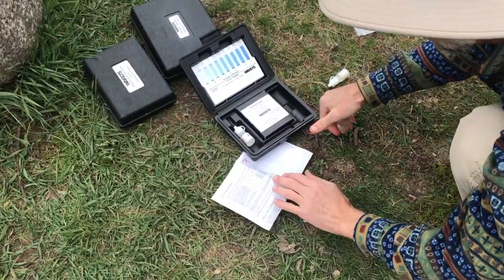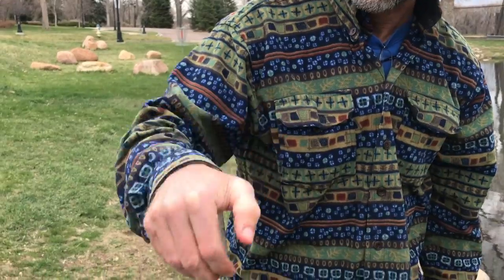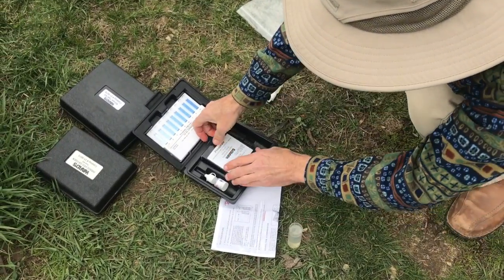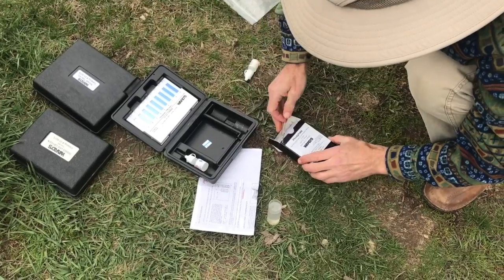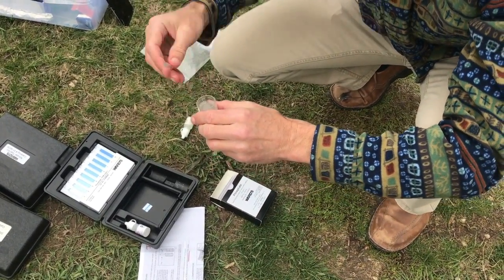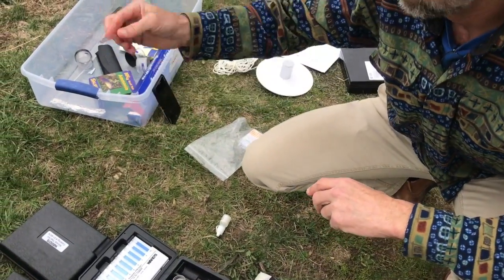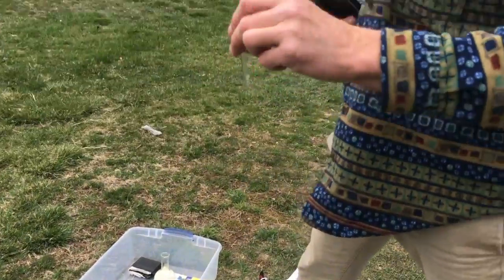And then we stir it up. I'm just going to shake it. And we'll snap off an ampule in there. These ampules are pretty handy. Invert it a couple times. And we will start our timer for just 2 minutes for our phosphate test.